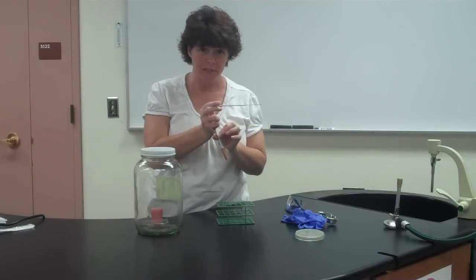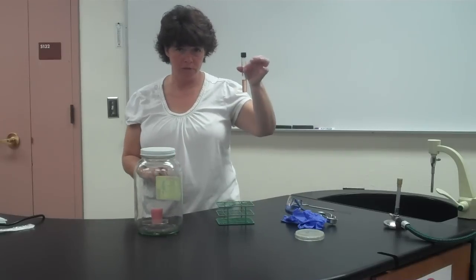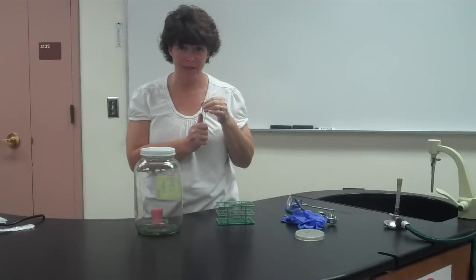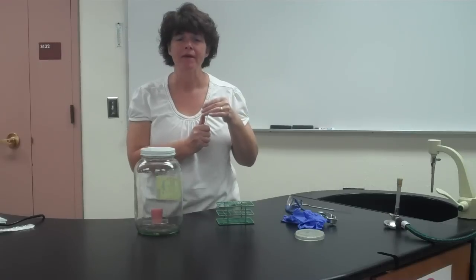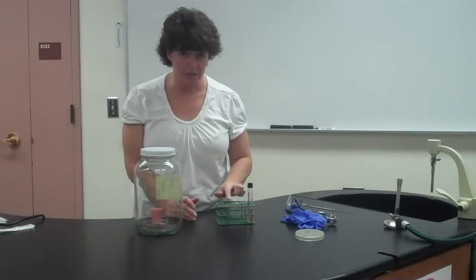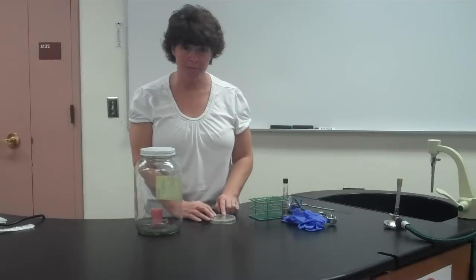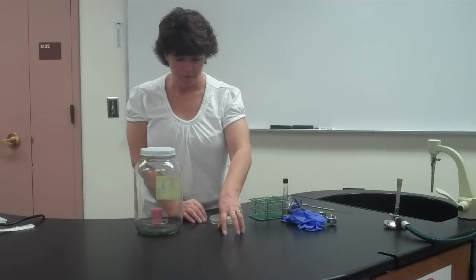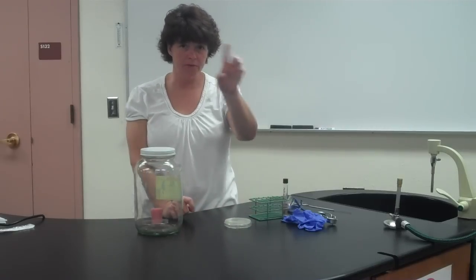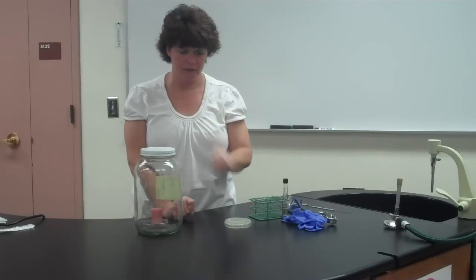In the past I've told you to leave lids loose, but because we're trying to make an anaerobic environment, tighten the lids completely — not so tight you can't get them off, but don't do that quarter-turn back. For the tubes, one bacteria in each of the four tubes. For the plates, divide them in half and put one bacteria on each side. Instead of the back-and-forth motion, just do a line like with the differential media so they don't grow into each other.